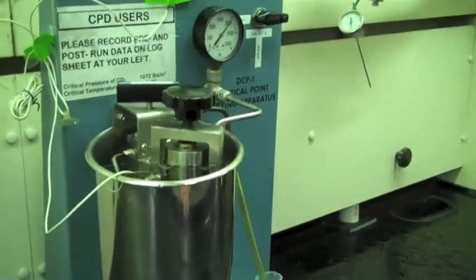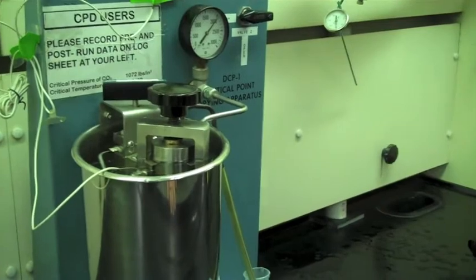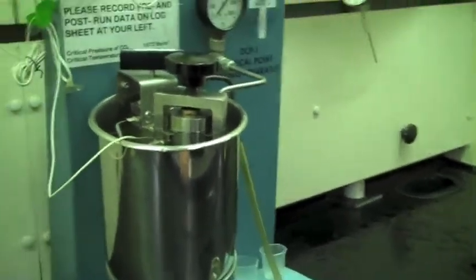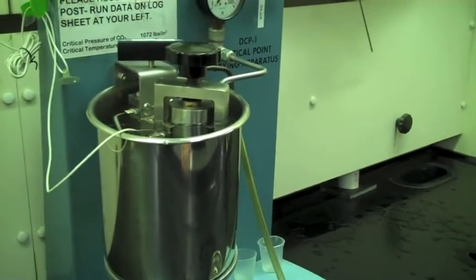And then I'll close the system down again and see if it still rises. If it doesn't, I'm good to go down on that slow but steady vent down at a hundred pounds per minute.